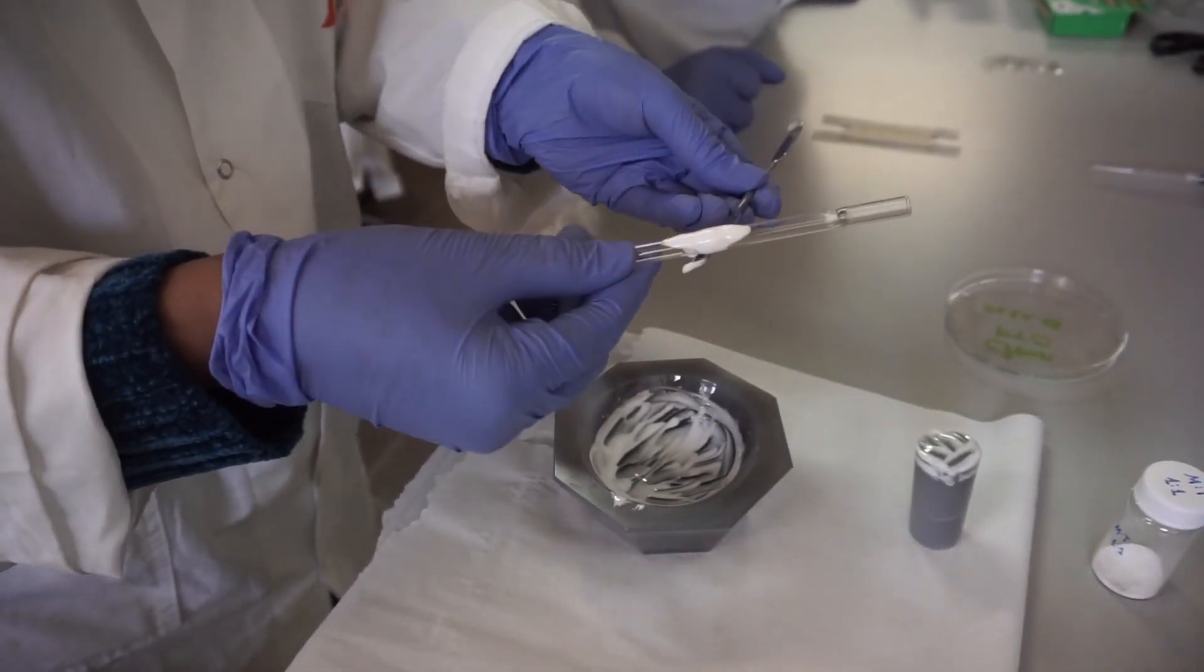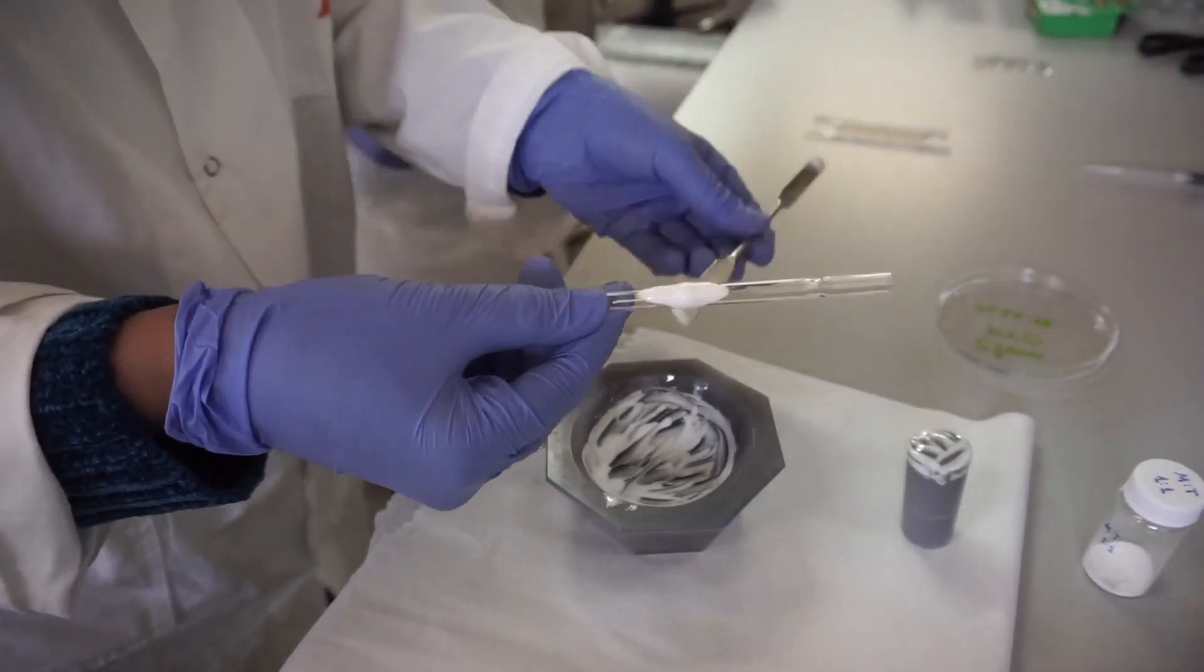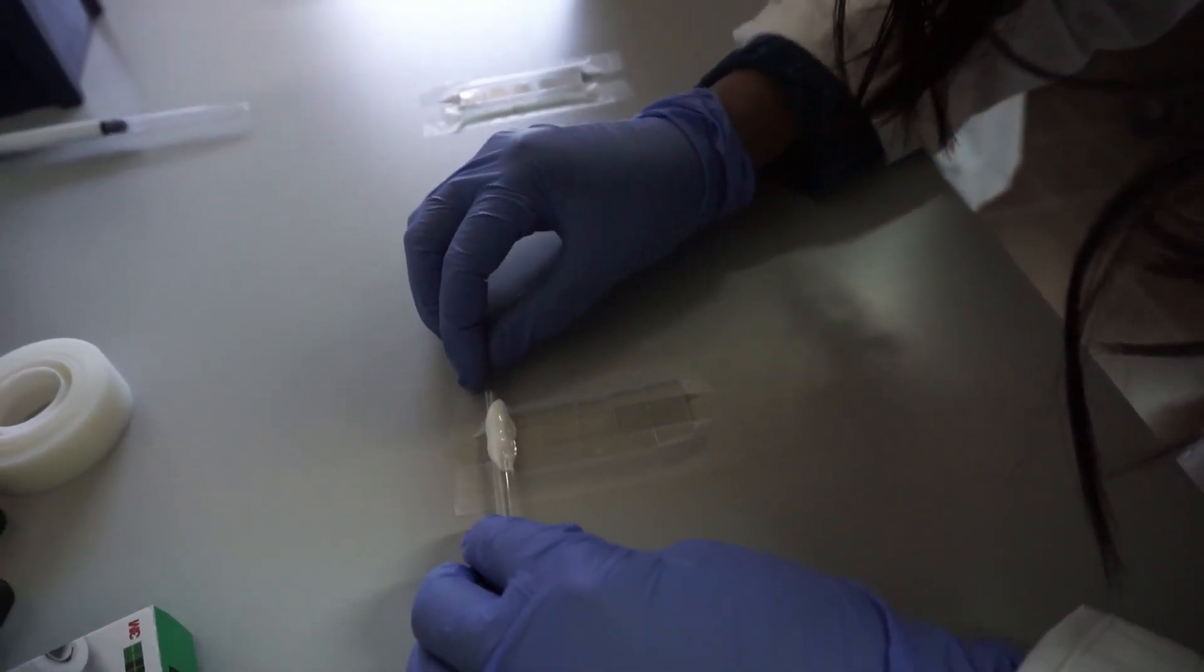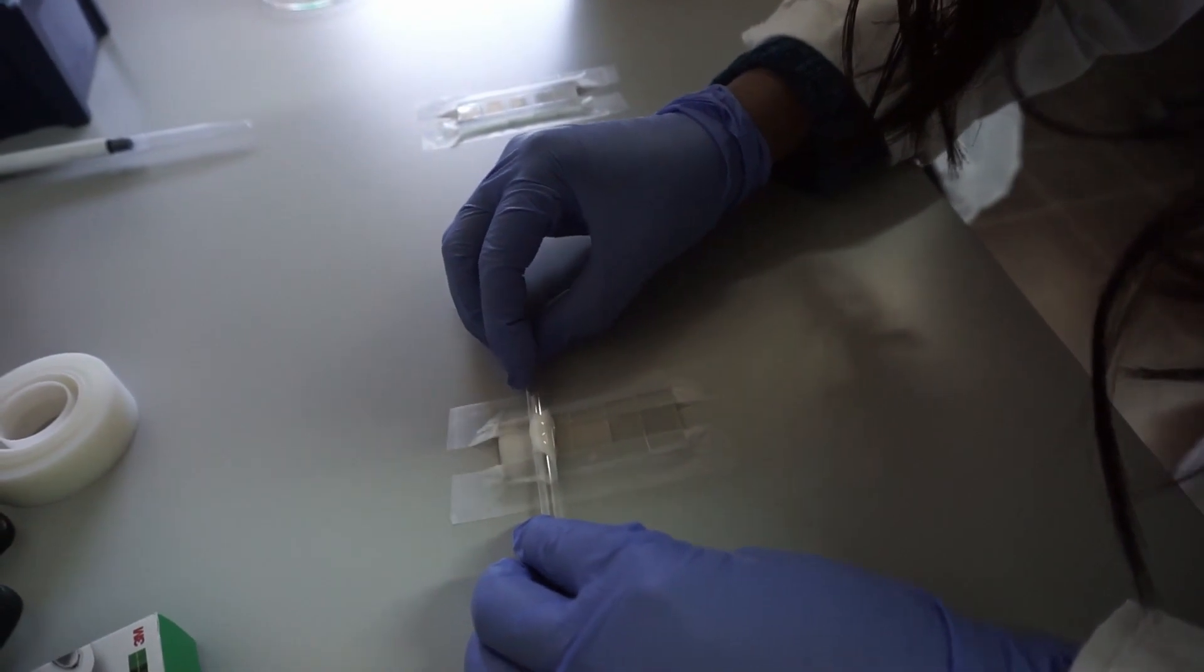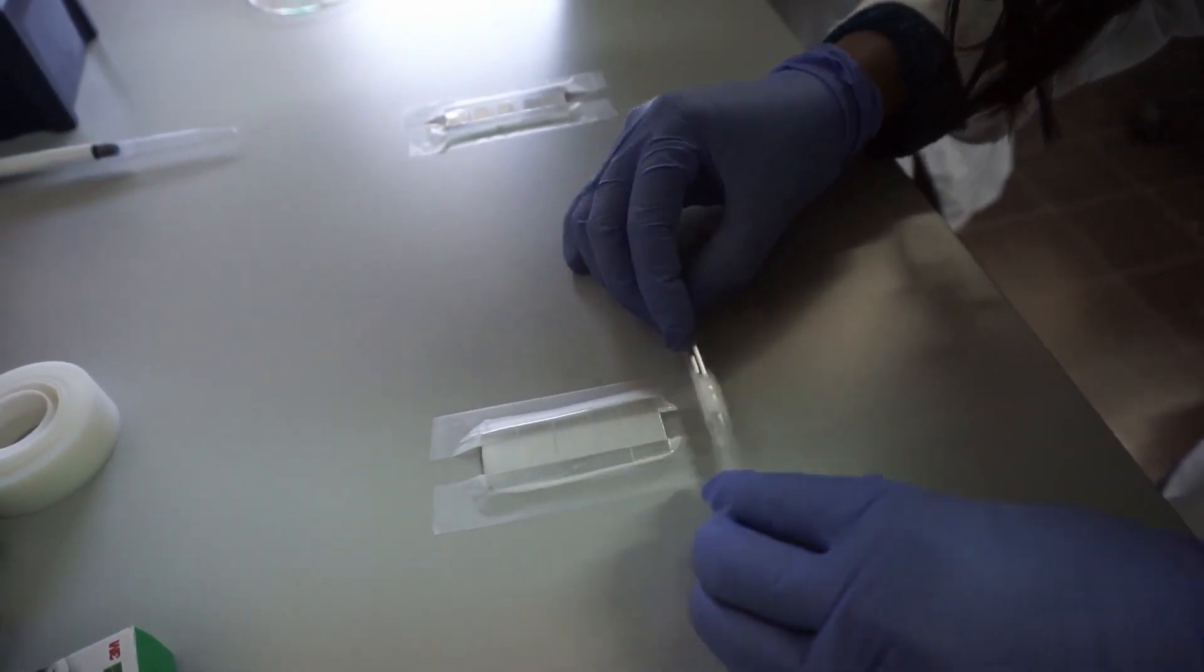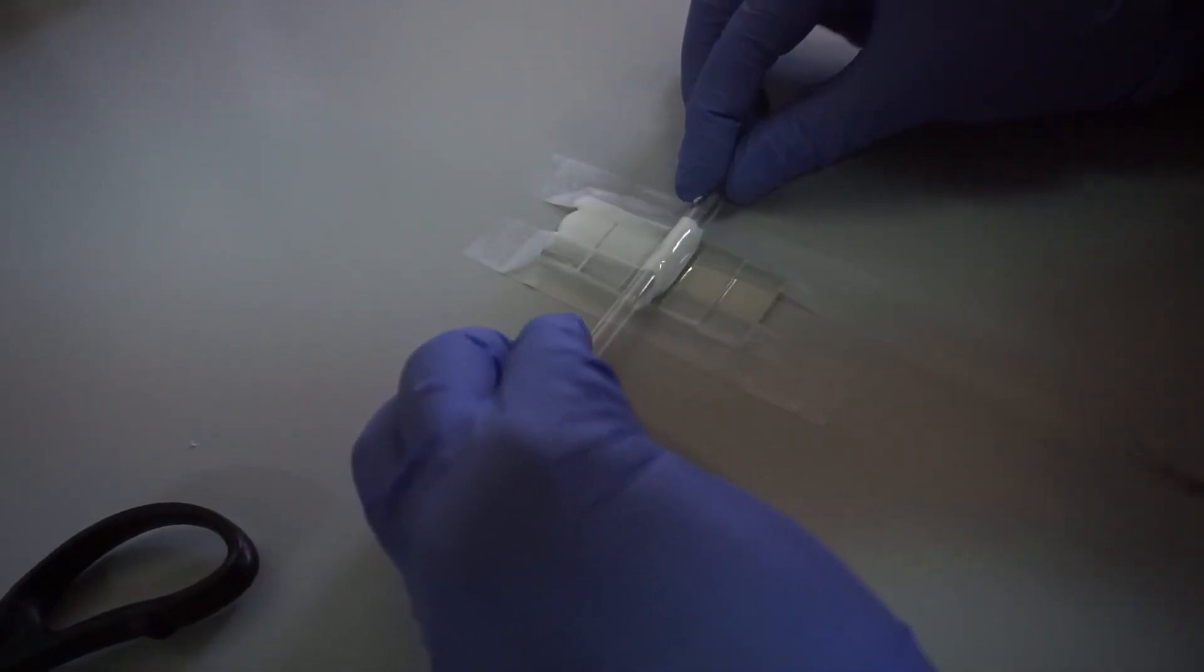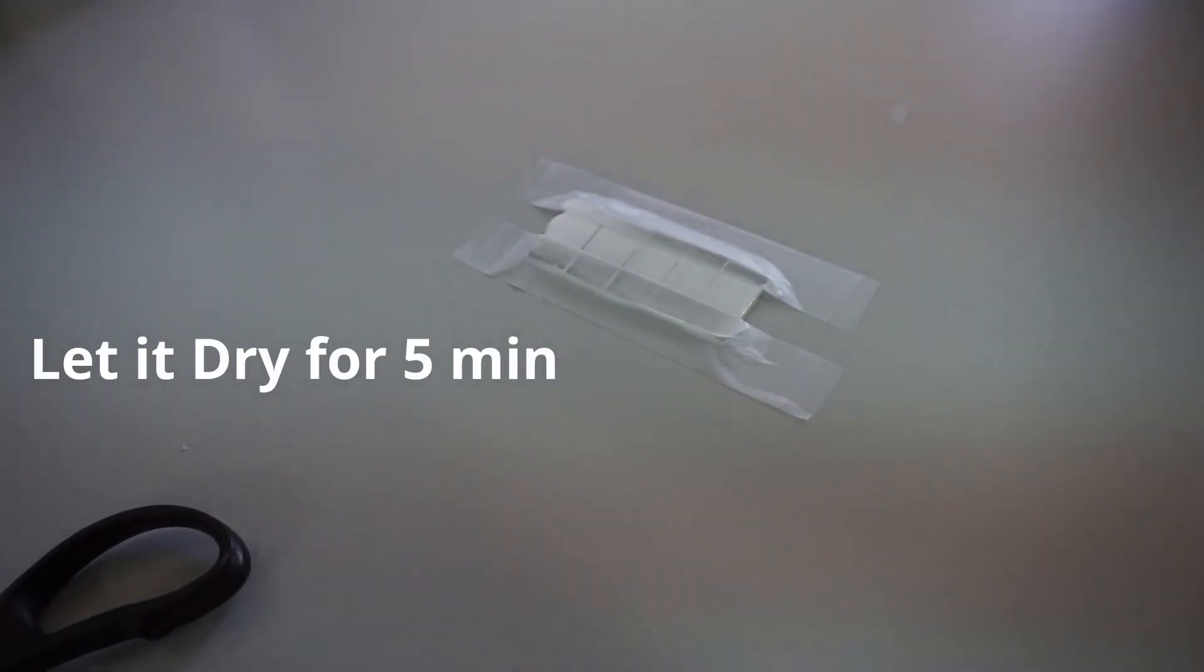Apply some paste on a glass pipette and use it to spread your paste on the FTO in a swift and continuous motion. Going back and forth with the pipette to ensure smoothness is not recommended as it is more likely to disturb the homogeneity of your layer.